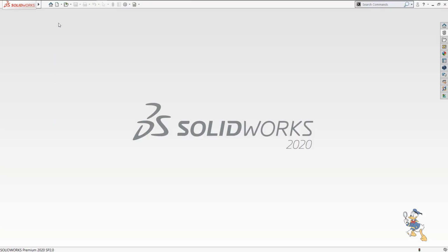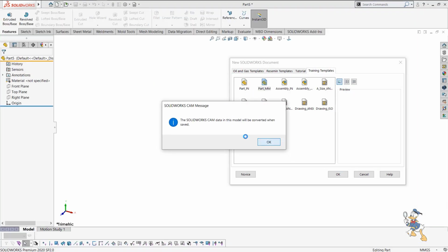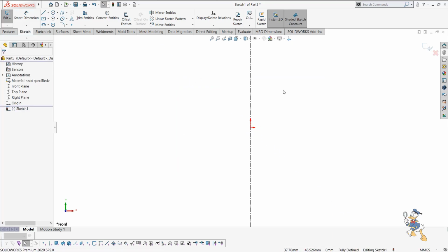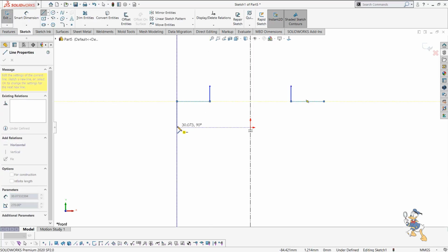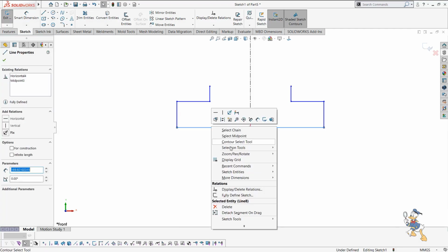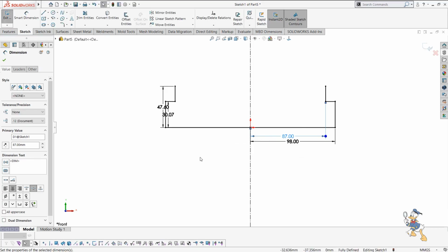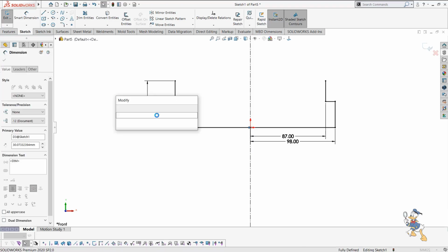Here we are going to start a new session of SolidWorks with sheet metal component design. So we just need to create a sketch over here first. I'm using some shortcuts. I just need to draw some lines over here. As you can see, it automatically mirrored the line which we need to design. With reference to the mirror line, I can define my sketch very easily. I just need to define the dimensions, and we are ready with the sketch.